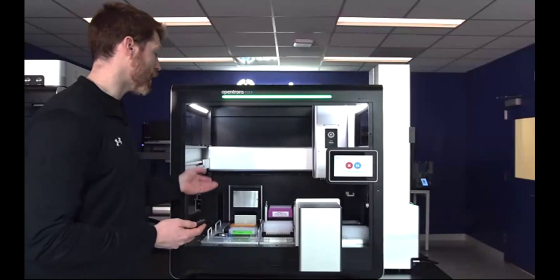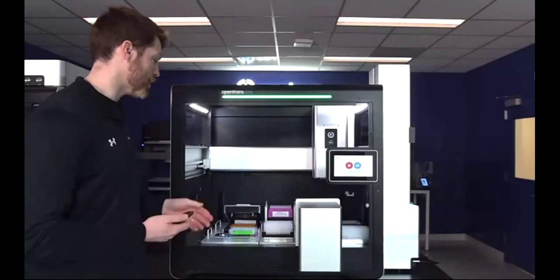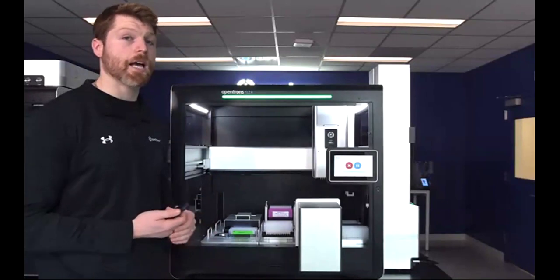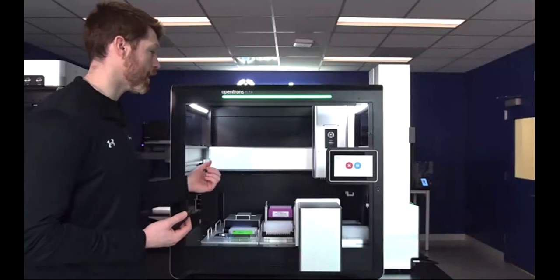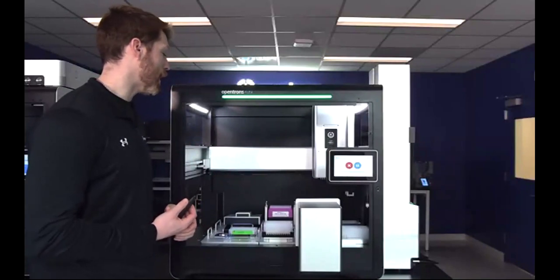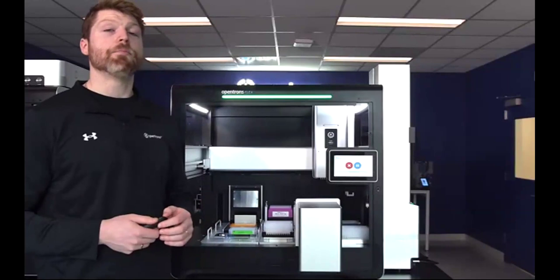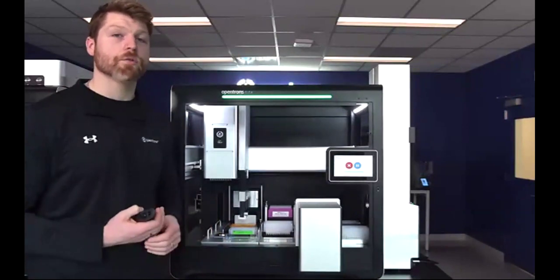Just a minute ago, you also saw our new labware, which is the auto sealing lids, which was just placed on top of our Opentrons Tough PCR plate in the Opentrons thermocycler. So the thermocycler is just going to open here in a minute, and you can see that afterwards, we'll use the same gripper to then throw this plate away. We do recommend that these are only for single use, but they do have a really low evaporation rate and guarantee sterility if you are running multiple cycles throughout your protocol.